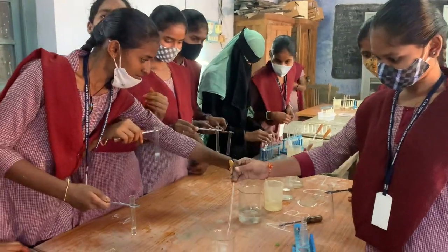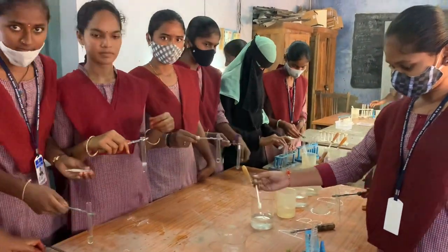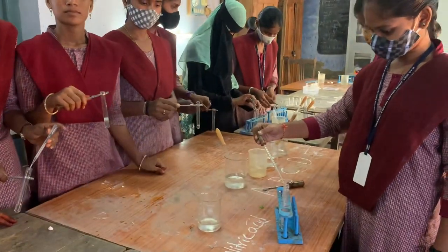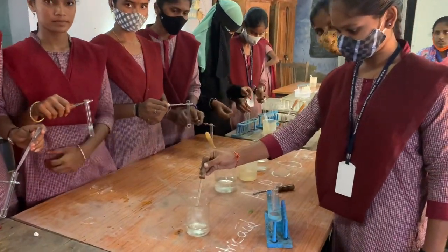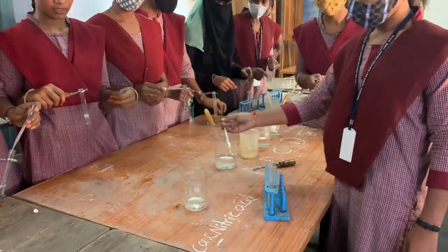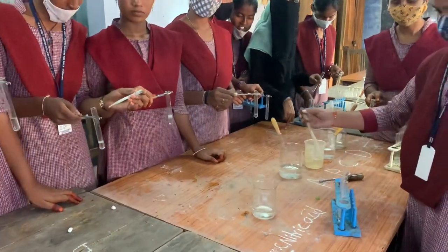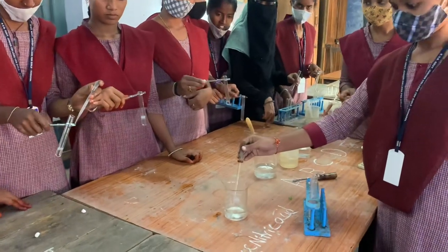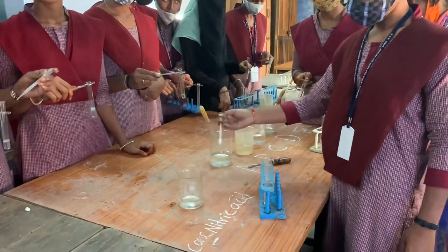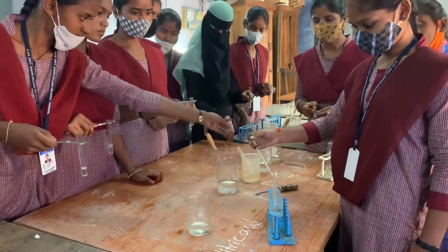Today we are going to identify the presence of albumin in the given samples A, B, C, and D. First, you have to take 4 test tubes, then add 1 ml of concentrated nitric acid in each test tube. Because it is acid, you have to hold the test tube with the test tube holder.